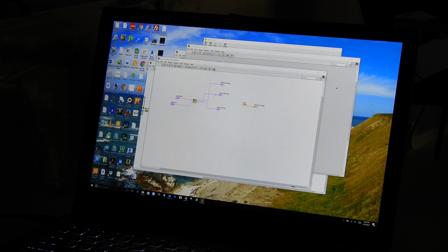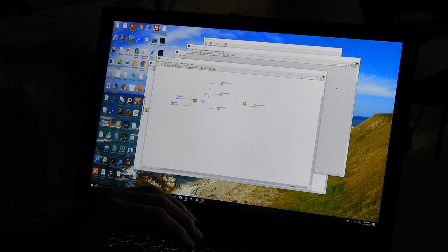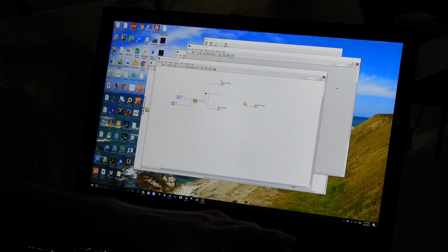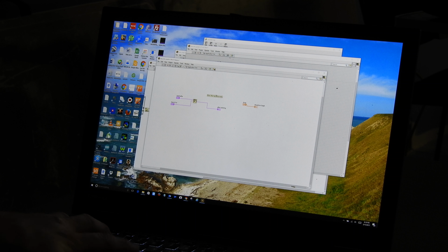I'm going to get rid of match substring because we already know what the match is supposed to look like. I'm going to get rid of it. I'm going to get rid of before substring. Let me just get rid of these wires. I can do a Control B to get rid of bad wires. Now I've got the after substring. We're going to want to parse the after substring.